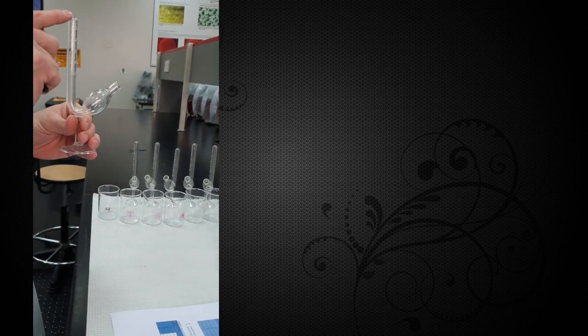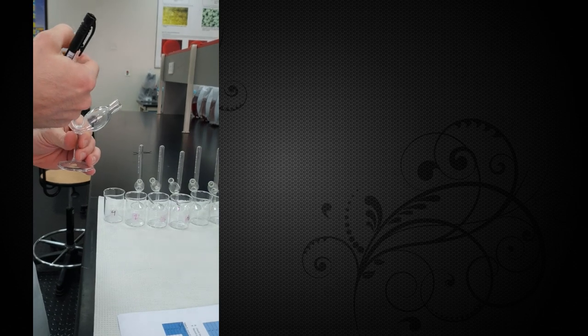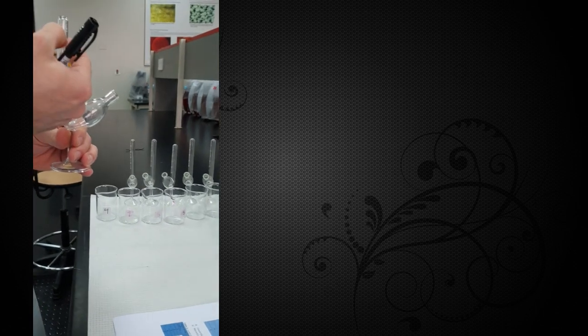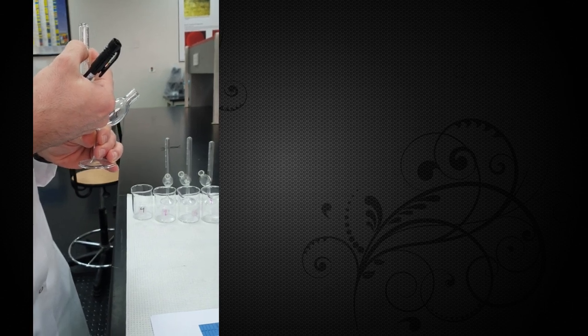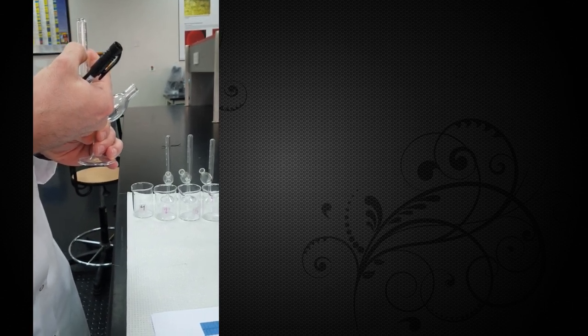We're going to do that by looking at how many bubbles of gas are being produced. We're going to be looking at the amount of CO2 production, and as the amount of CO2 builds up as more fermentation happens, we're going to see an increase in the amount of bubbles in here.